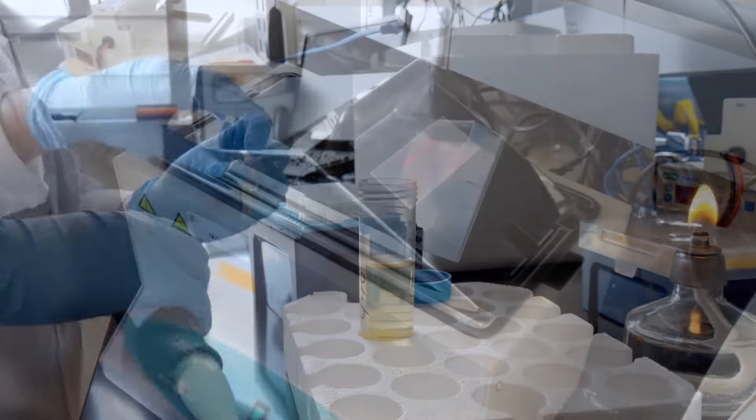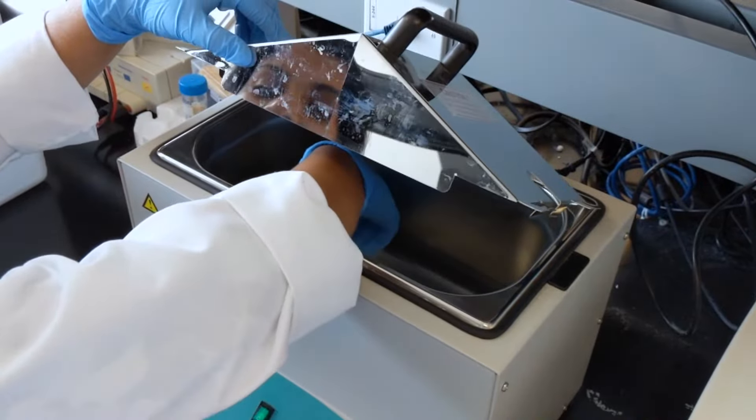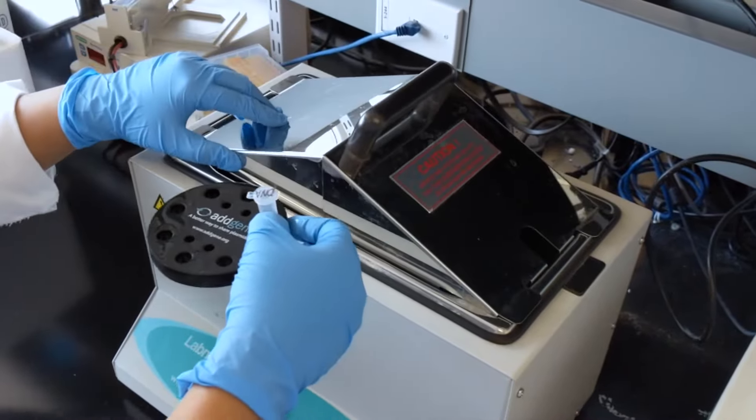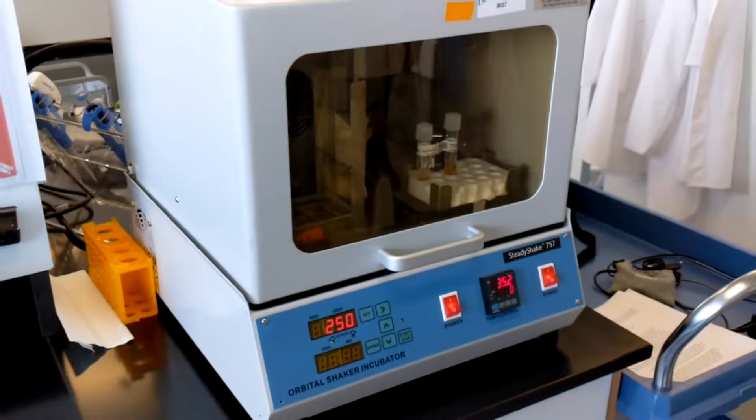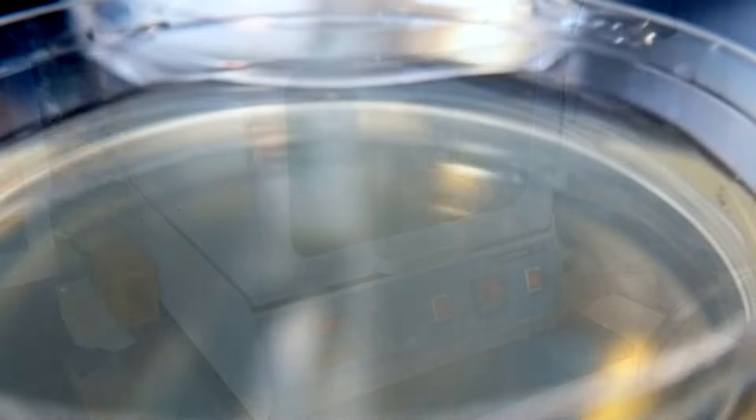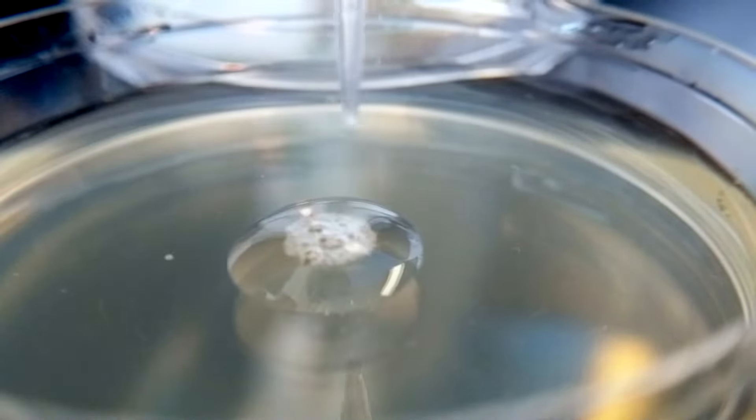These are known as competent cells. In this video, we will show you how to use a standard transformation protocol to introduce plasmid DNA into competent cells in order to store and replicate your plasmid of interest.